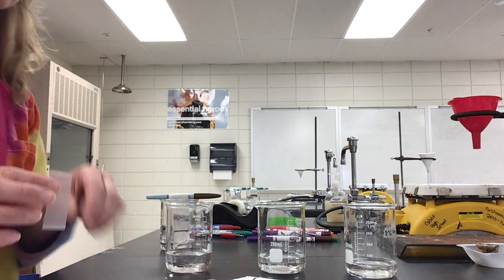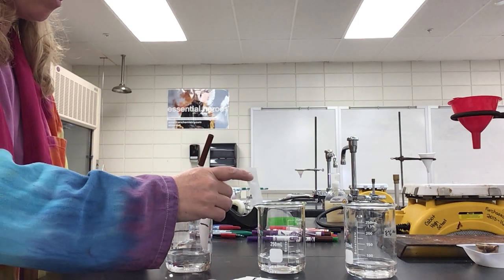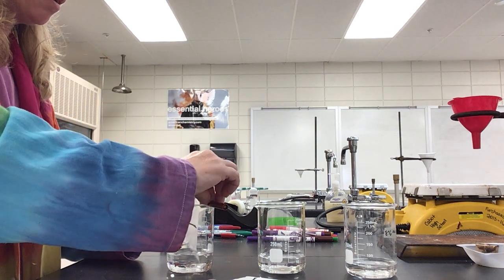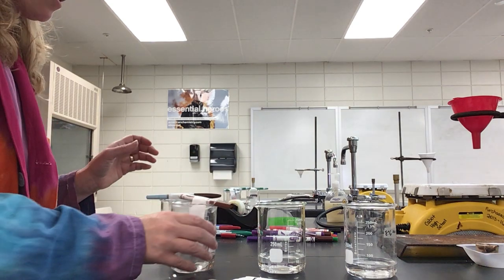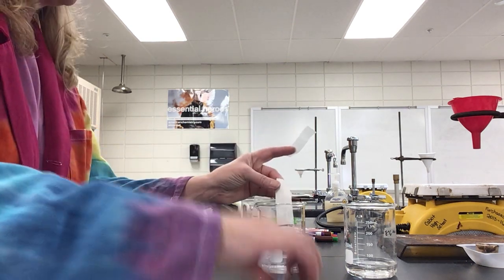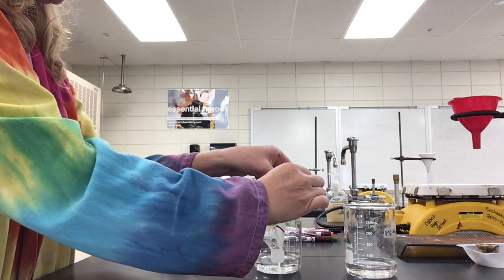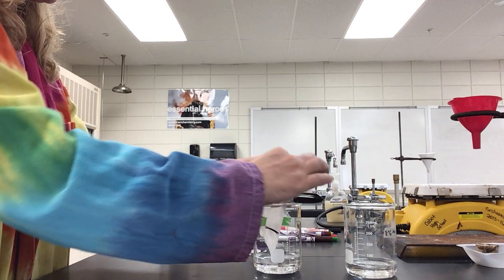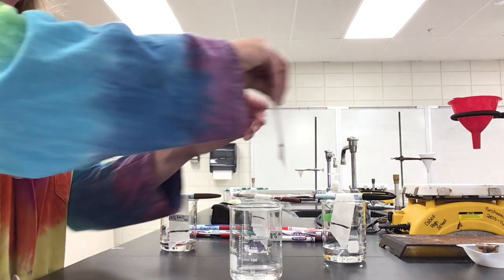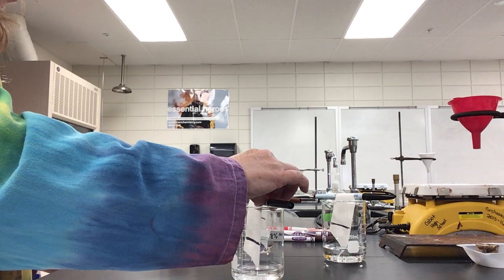So I'm going to set that back, and now I'm going to do my next brown. Do the same thing, make sure that's touching the water, okay? All right, and now I'm going to tape that one on my next pen, like so. Set that one back. Let's do the next one. All right, got that one on there, taped, and now let's do the last one. So here's what I'm doing. I'm comparing Vis-a-Vis with Crayola, okay.